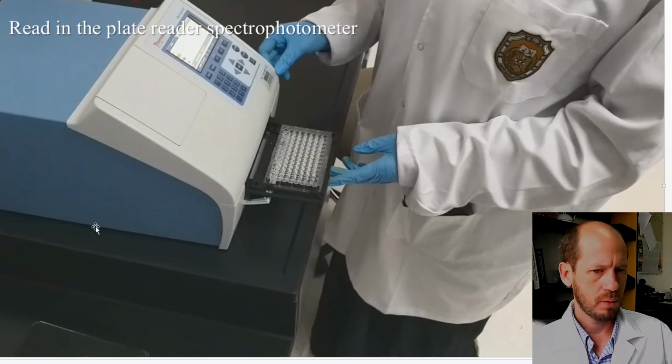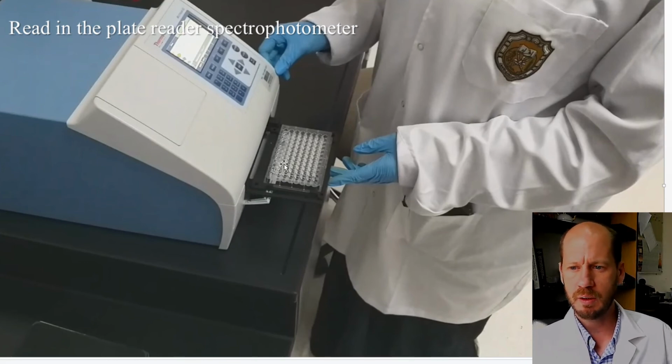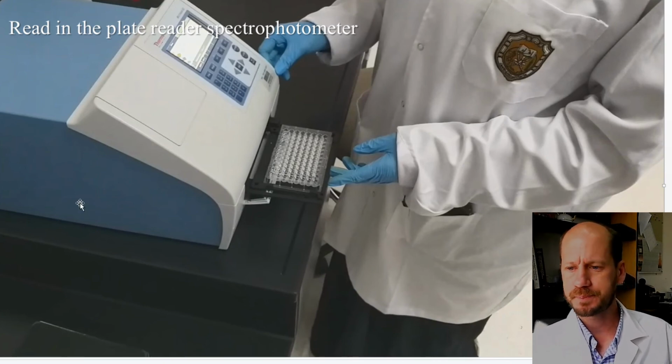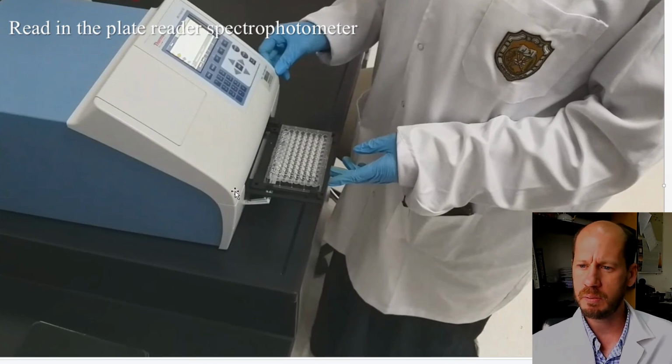Okay, so I will give you the spreadsheet for these calculations, and for more details on these calculations, please watch the previous videos, the practical on the moly blue P, and also on the potassium measurements in soil extracts. The procedure and calculation are similar. It's just that instead of analyzing an extract for the soils, we are analyzing the filtrate from the dissolved ashes from the plant material.